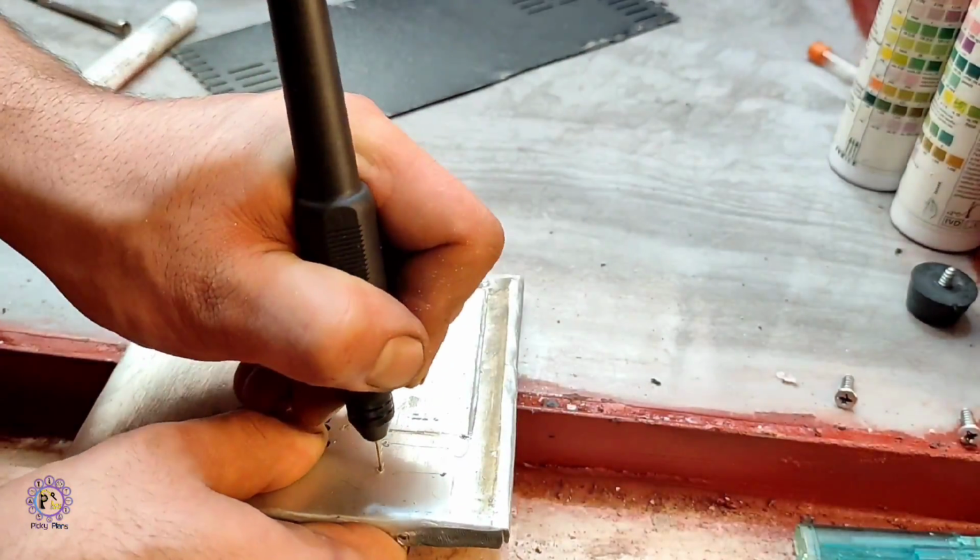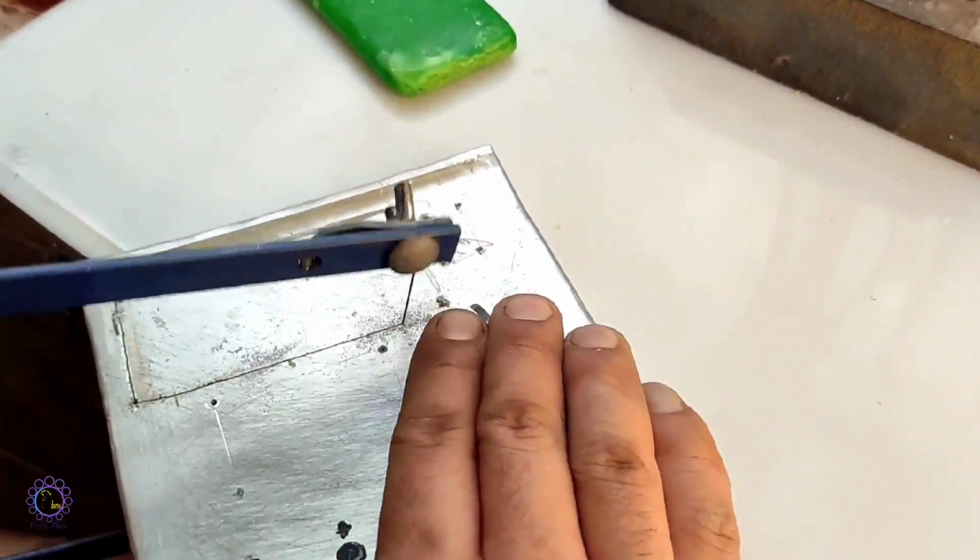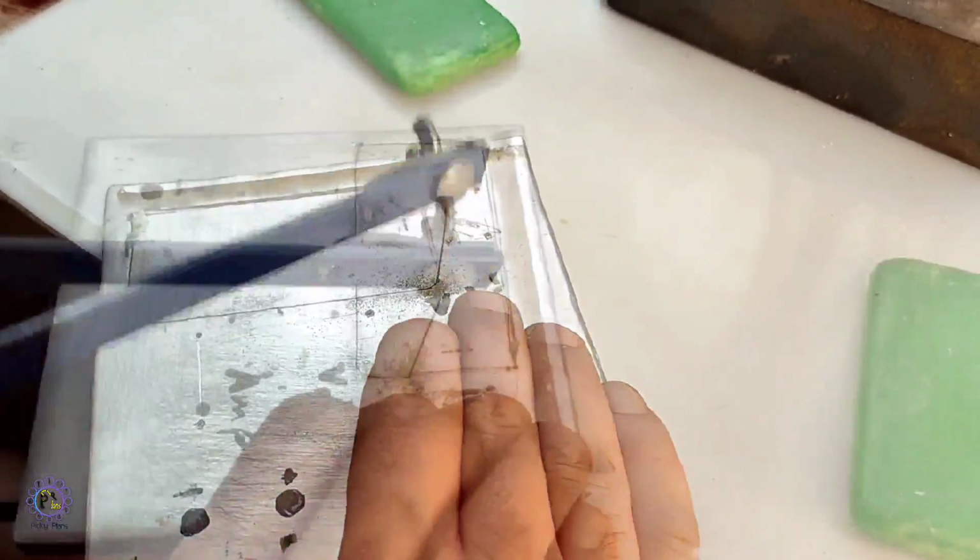After marking everything needed, I started cutting the marks with a saw while lubricating with a solid soap.